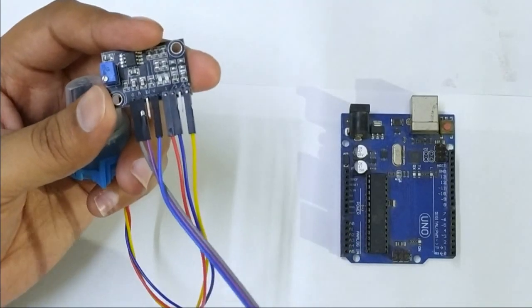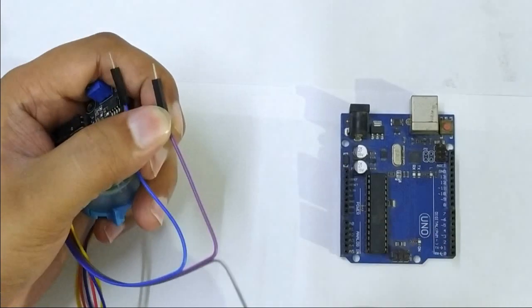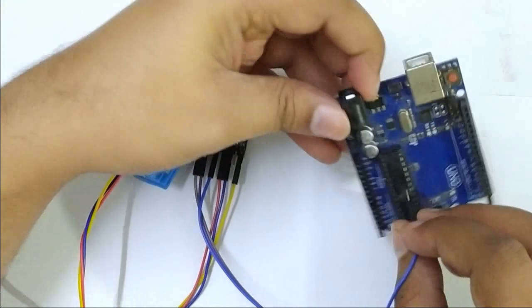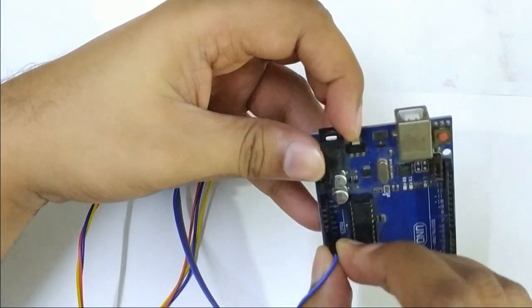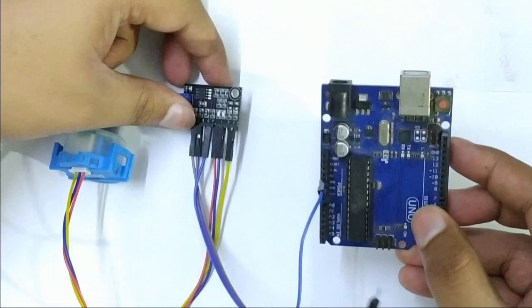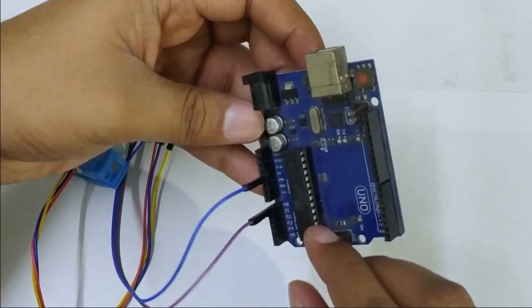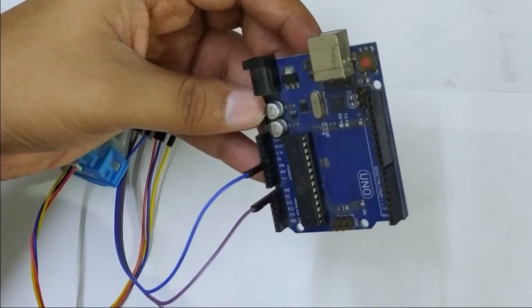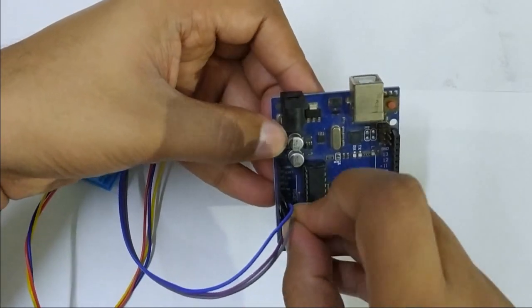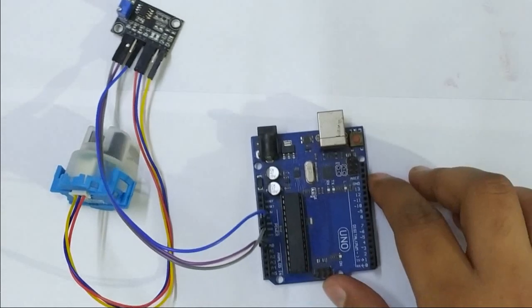So we are going to connect to the five volt. This is connected to the V, and the purple wire should be connected at the A0. It's not actually important, you can connect at any analog pin A0 to A5, and the gray wire is connected to the ground. So the connection is ready, now let's just connect the Arduino to the computer.